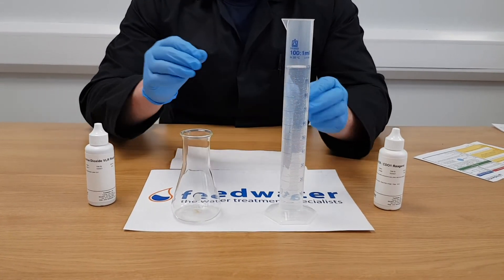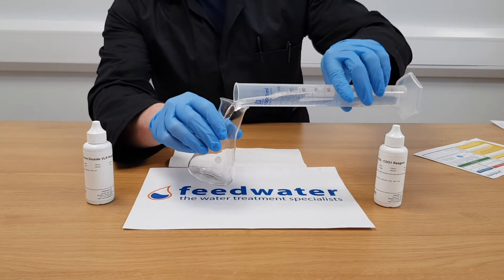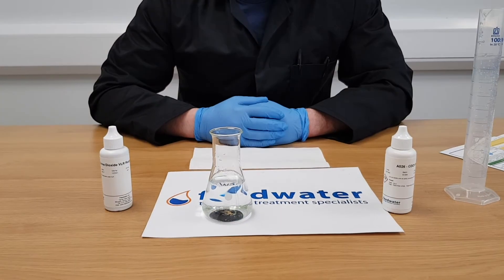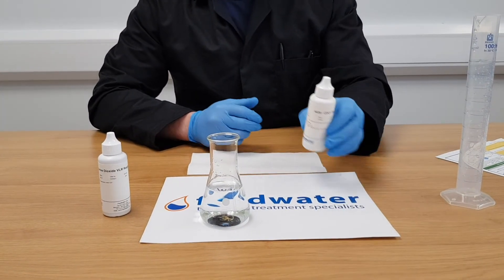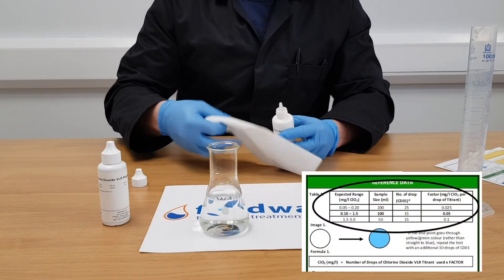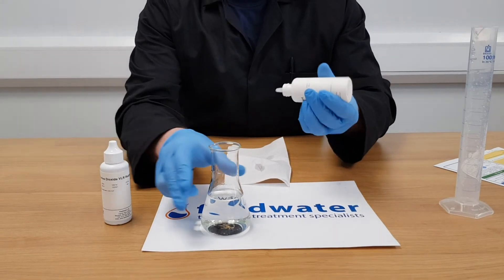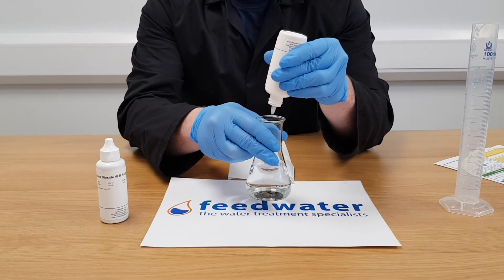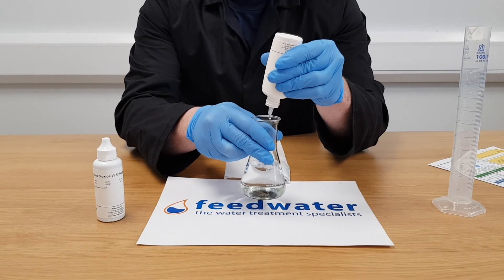First take the required volume of your sample. The number of drops of CDO1 solution required varies depending on your sample volume as shown in the table. 15 drops are used for a 100 ml sample. Add the specified number of drops of CDO1 solution as indicated in the reference table and swirl to mix.